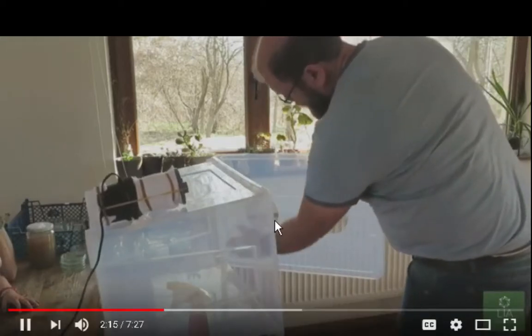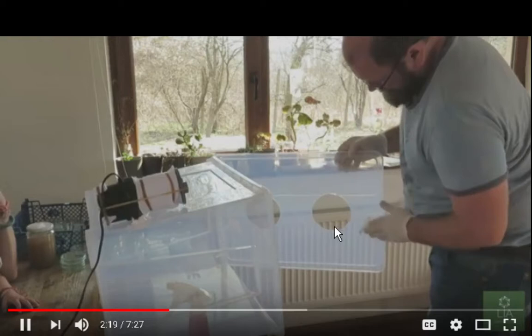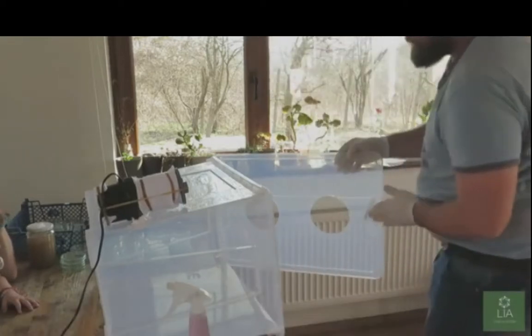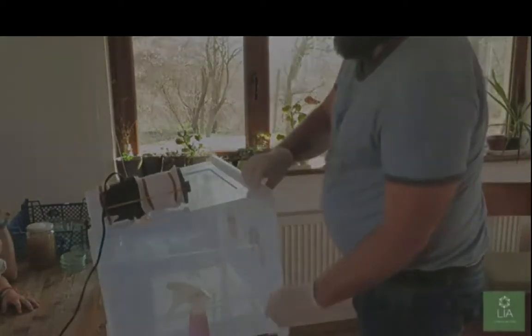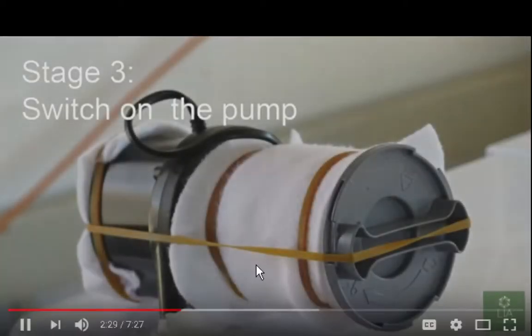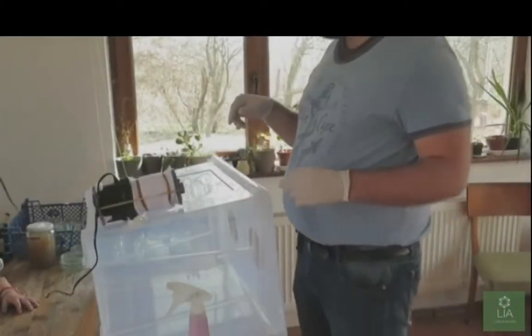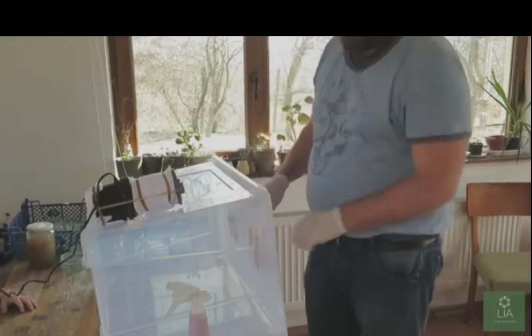Oh, he's got 2 holes here for this, and they're probably just open. I mean, you can wipe all this stuff down, and there's still... Oh, he's got a filter on this pump here. We're all cleaned up, so we'll start the pump. Oh, that is noisy.